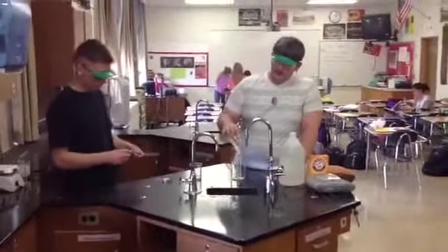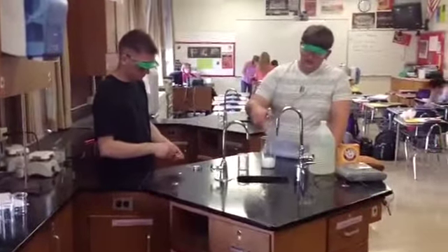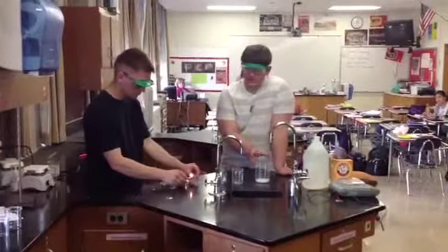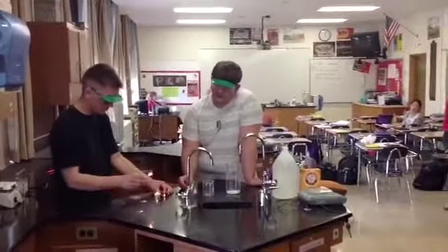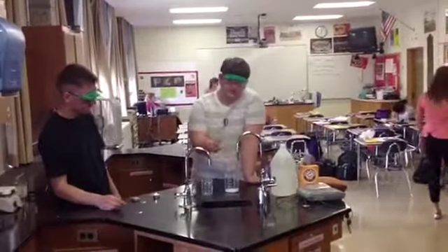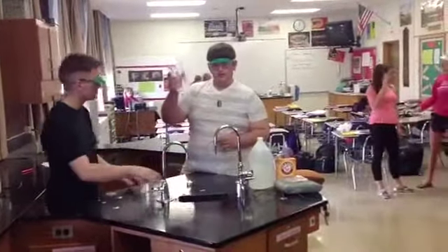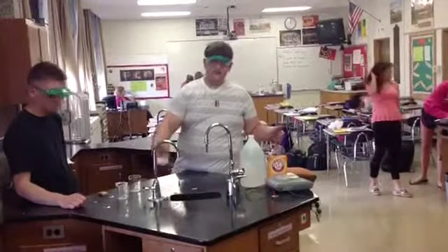So we mix the sodium bicarbonate, and then we add our vinegar. Bubbles slightly, no explosive reaction. To illustrate that there is carbon dioxide in this cylinder, I'll take the candle that can be moved around a bit more readily. Just into the cylinder, goes right out. Carbon dioxide. Without oxygen, fire cannot continue. So if you take a full cylinder of clear gas, pour it right over the candle, goes right out.